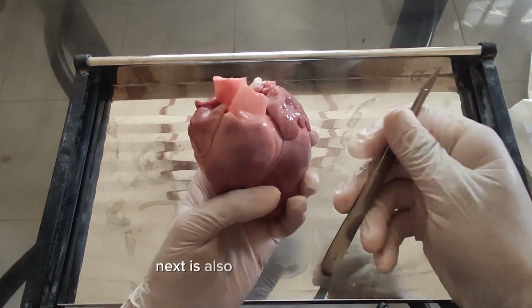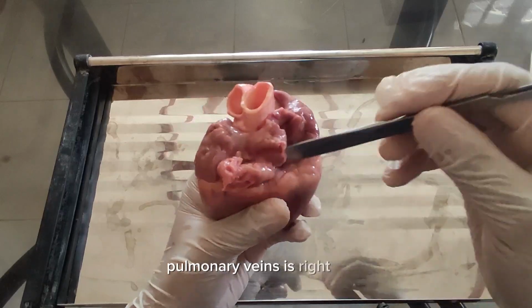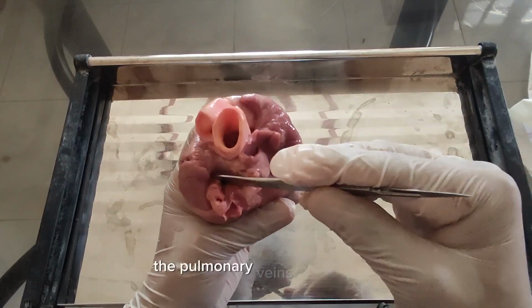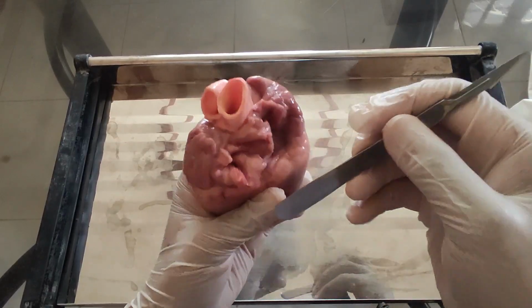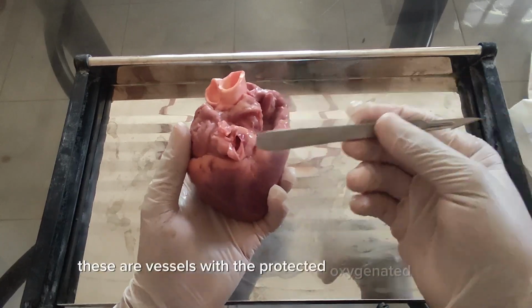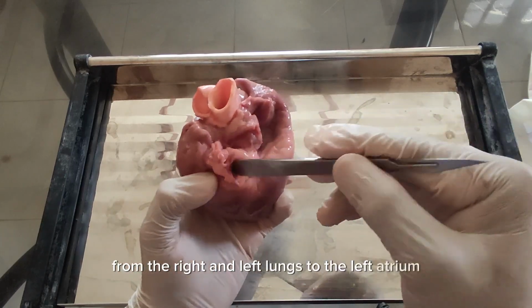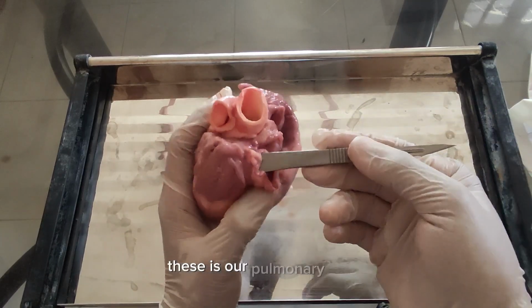Next are our pulmonary veins. The pulmonary veins are right here. These are vessels that return oxygenated blood from the right and left lungs to the left atrium. These are our pulmonary veins.